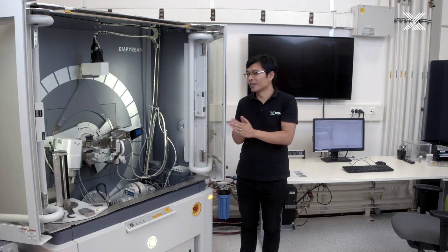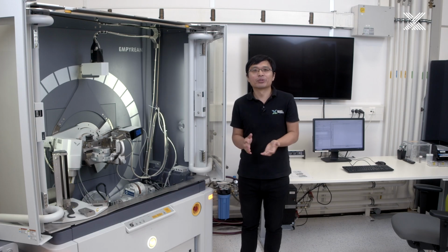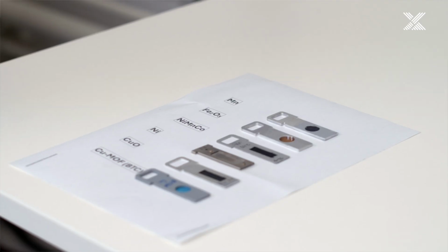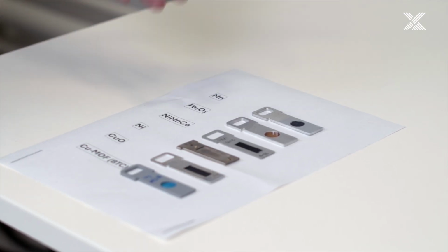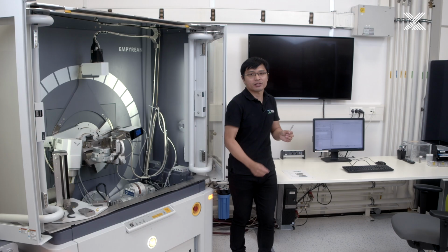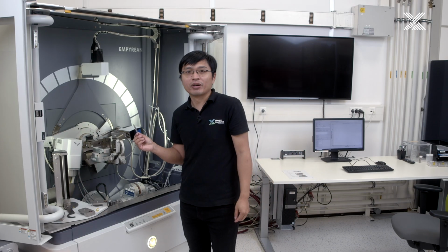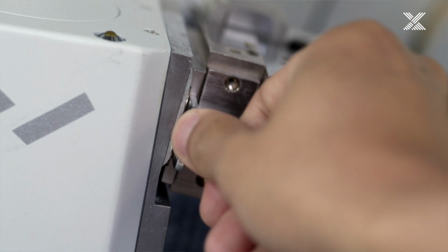Okay, after showing you all the components of this XAS application on the instrument, I'm going to run a measurement and show you how to do the measurement. I will pick up a sample from here, a prepared list of specimens covering different applications, some oxides and also some materials from batteries, some amorphous material for catalyst. I will pick up this iron oxide compound, which is prepared in pellet form. I will insert it not on the normal XRD stage, but into the slot for transmission mode measurement of XAS, which is here.